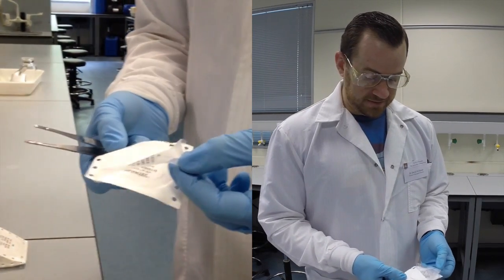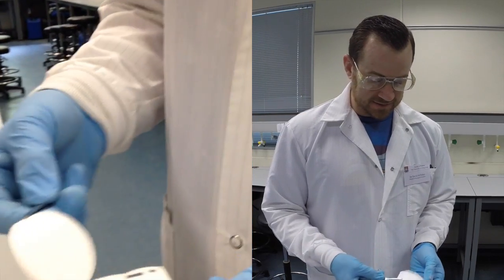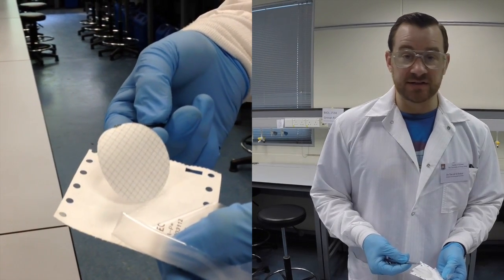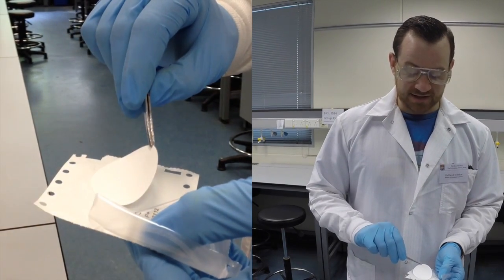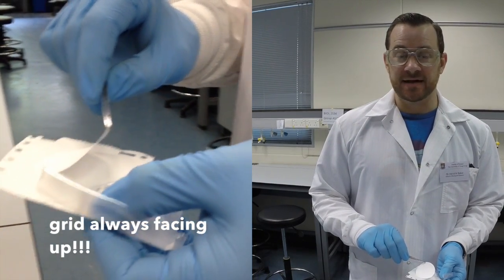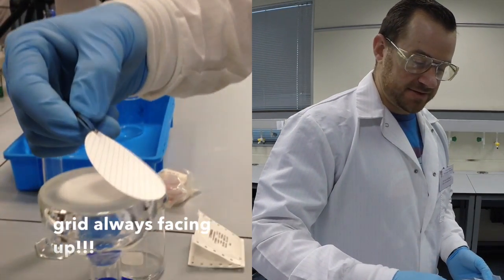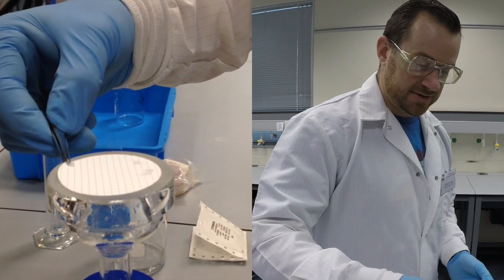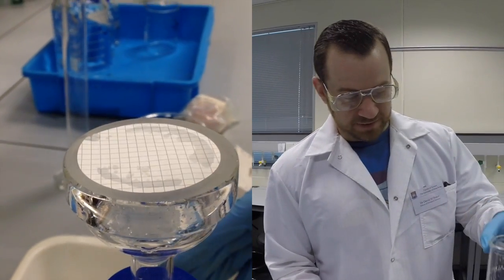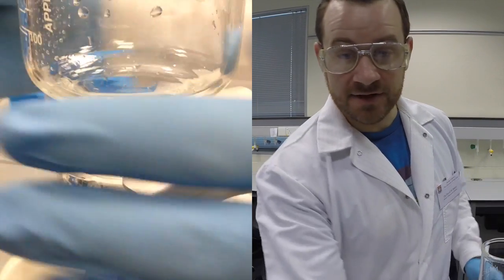I'm going to peel apart the membrane, and you'll notice that the membrane filter has two sides to it. One side has a grid, and this grid is simply to help you with counting the colonies that grow on the surface. On the other side, it's white. So this side should be placed down onto the media in the plate that will be used to incubate the microbes. So I'm going to place with my forceps the membrane filter onto the surface of my fritted funnel. I'll replace the top of the funnel and clamp everything back together, and then turn on the vacuum.